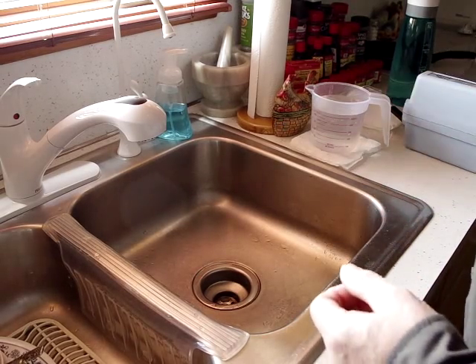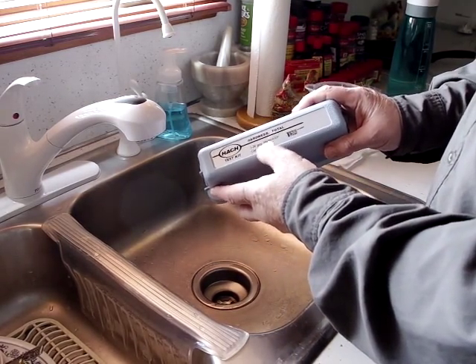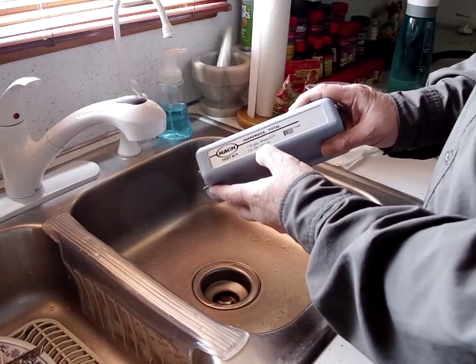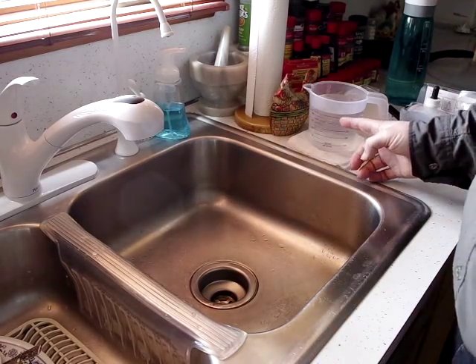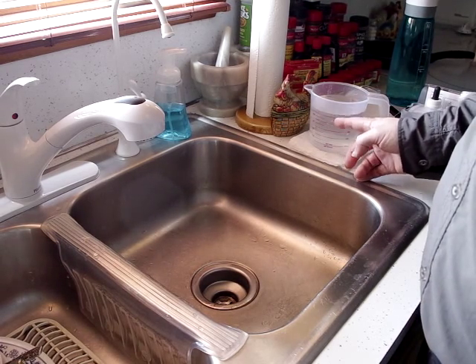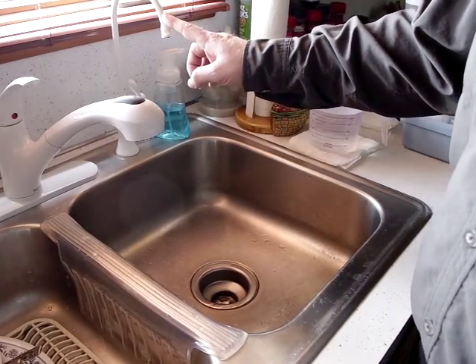What I'm going to do here is use the Hach Hardness Total Hardness Test Model 5EP, number 145400. I'm going to do three different tests: before the water softener, which is on a well — so this is well water — tap water, and reverse osmosis water.